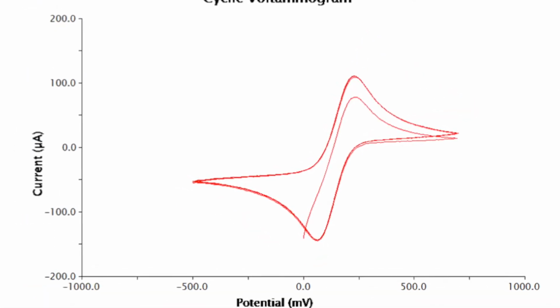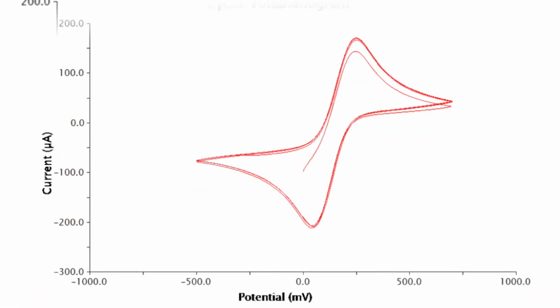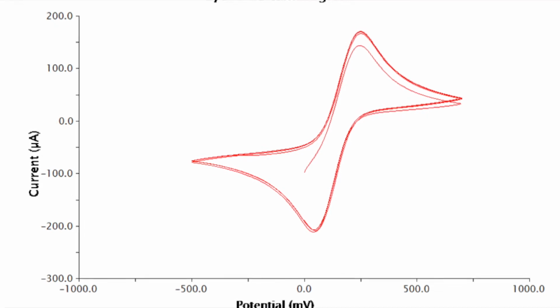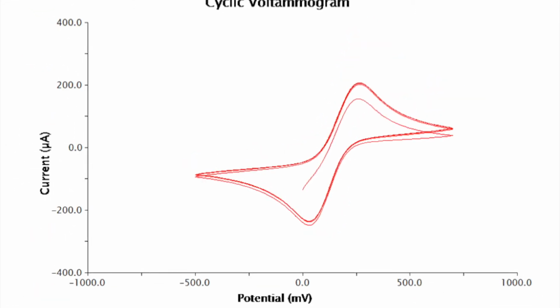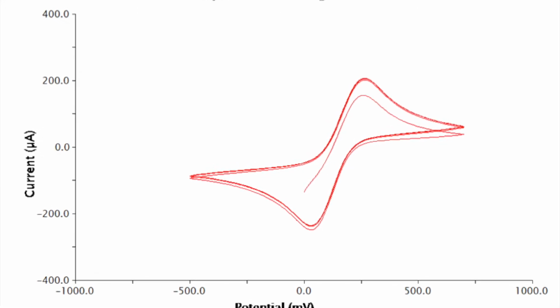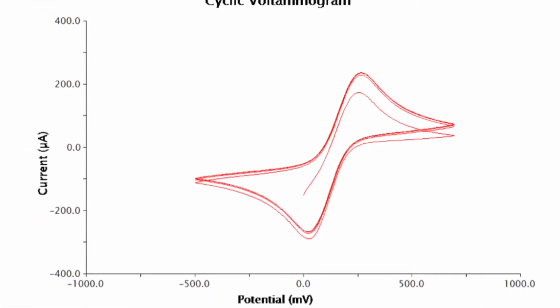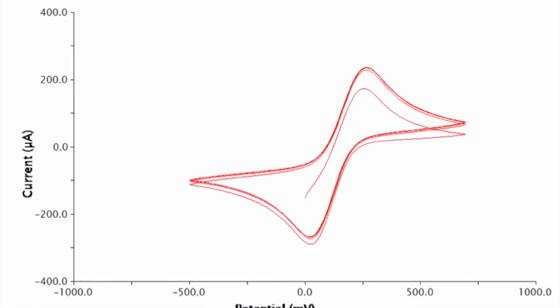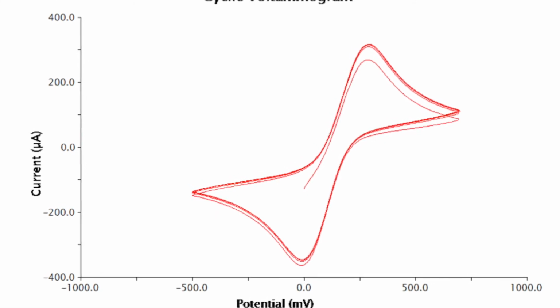After obtaining that data, we began experimenting with the sweep rates, changing the rate from 20 to 50 to 75 to 100 to 200 millivolts per second. The lower sweep rates took longer to draw the graphs compared to the higher sweep rates. In addition, the higher sweep rates seem to increase the electrode current range, as shown by the graphs that appear more stretched out.